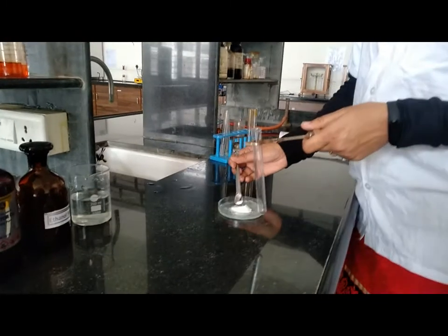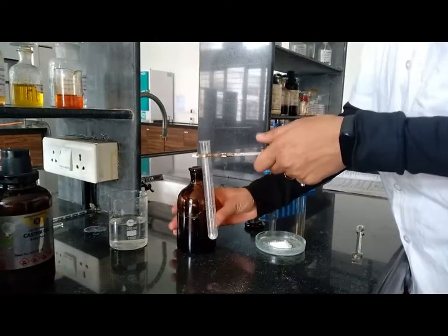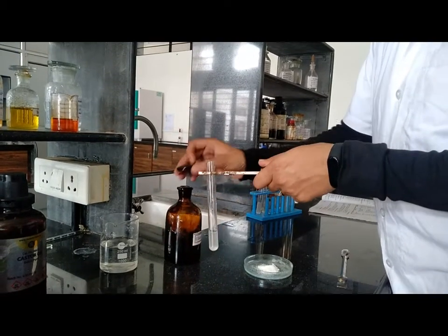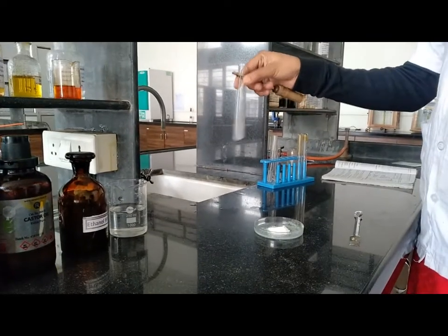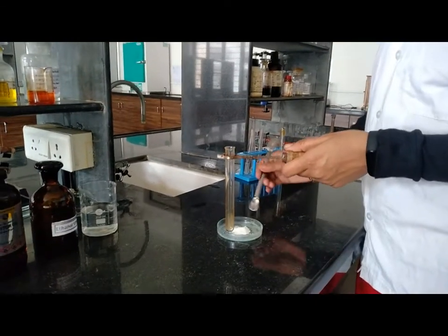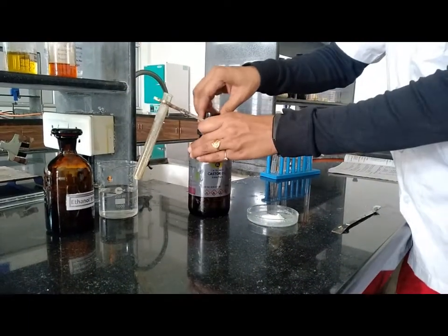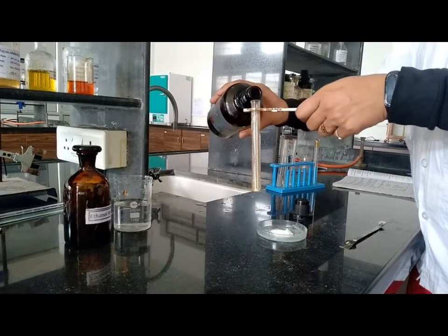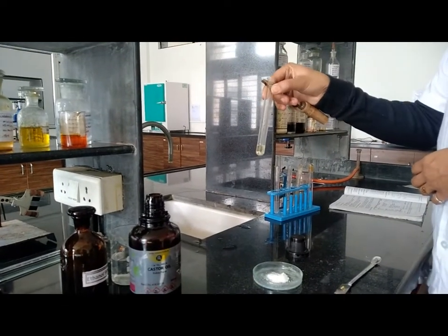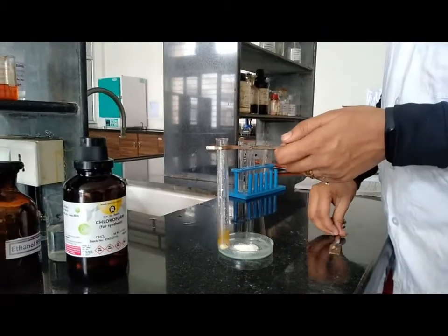Next, solubility test in alcohol: take sample, add ethanol and check the solubility — ampicillin trihydrate is insoluble in ethanol. Now check solubility in fixed oil: take sample and add fixed oil, here we use castor oil.